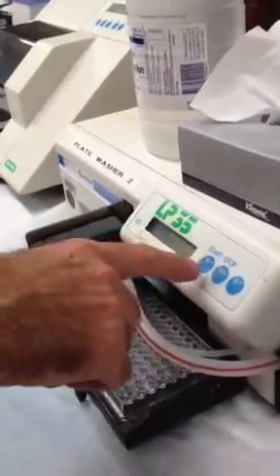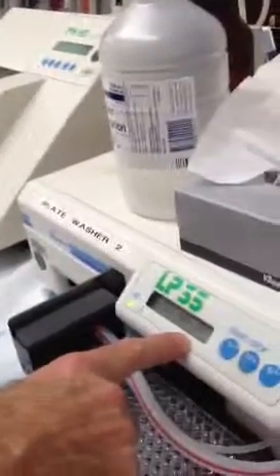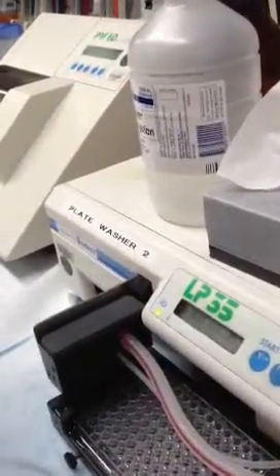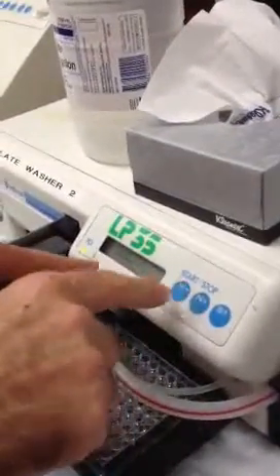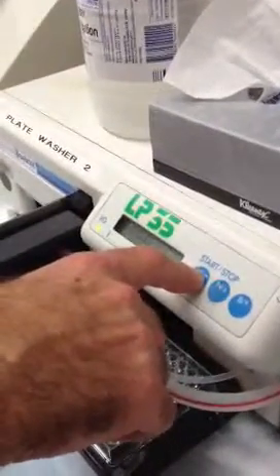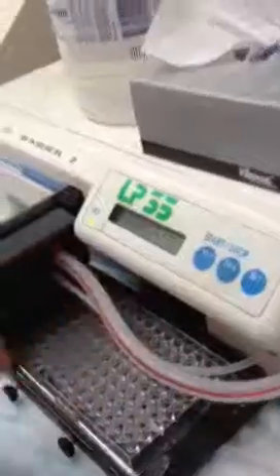So now I can wash. With the wash, we use Wash Cycle 7. The other one should be set up the same if there isn't a problem. Just try Wash Cycle 7 and let's see what it does. Wash Cycle 7 basically squirts for 70 seconds. Here's how many cycles you want — three or four cycles, or one cycle.